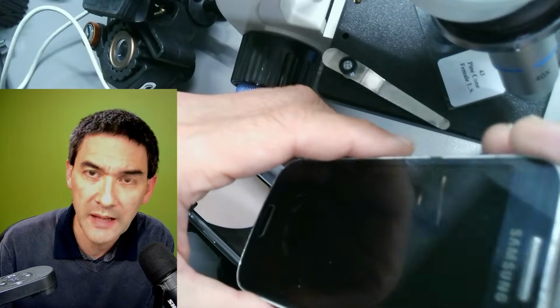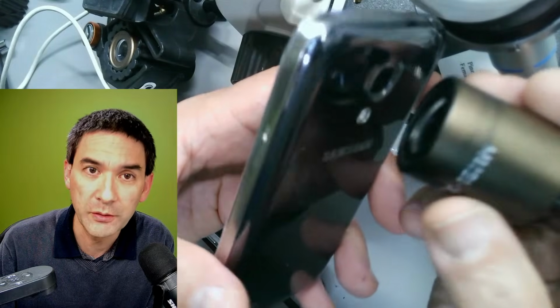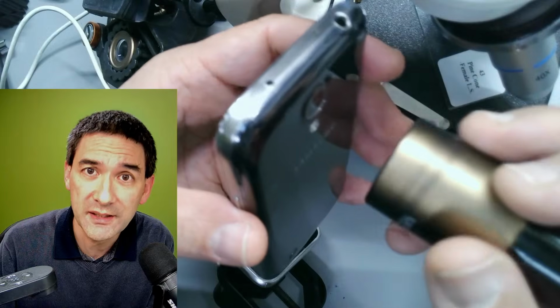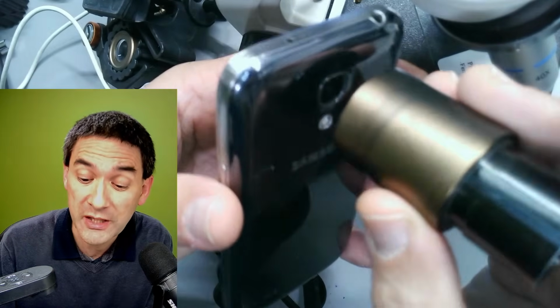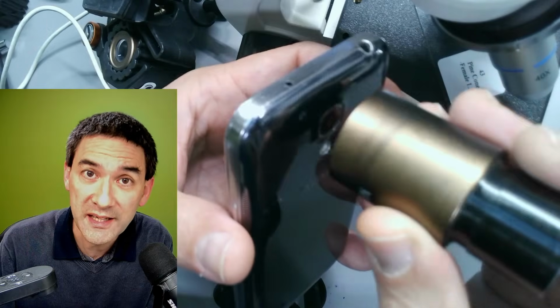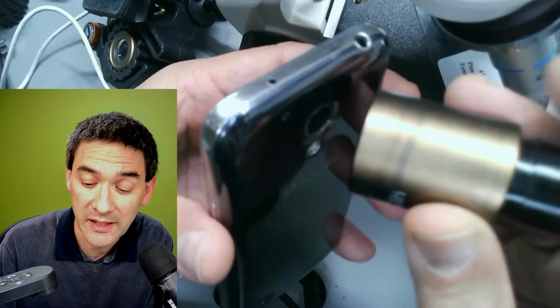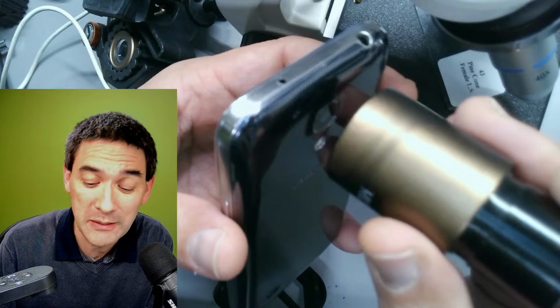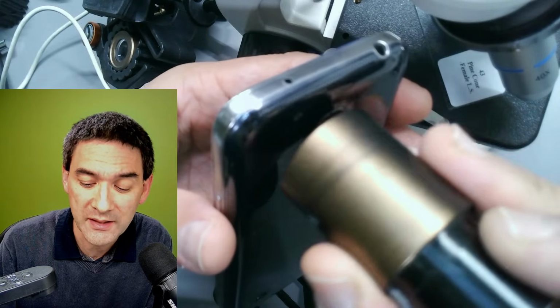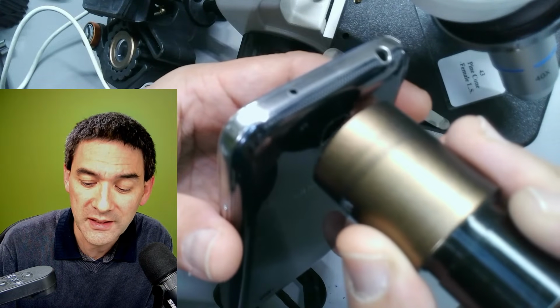So very briefly, if you want to take pictures using a mobile phone like this one through the eyepiece of a microscope, that's a huge challenge, because it is very, very sensitive to the position. It has to be centered very precisely, and the distance has to be correct as well, and also the angle has to be correct. Otherwise, you're not getting a good image. So let's have a look. Basically, one x-axis, y-axis, 2 dimensions. The third dimension would be the distance.